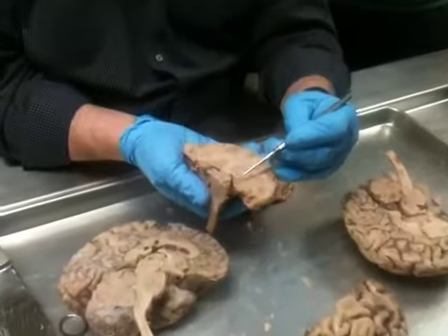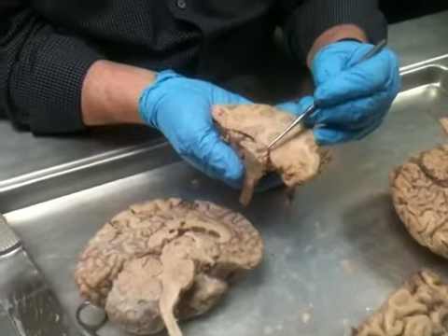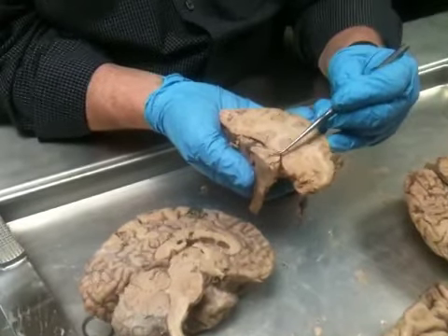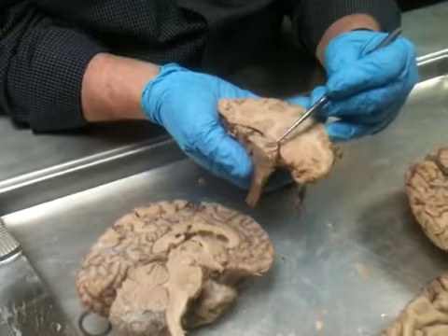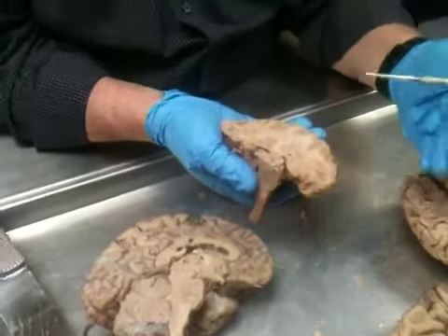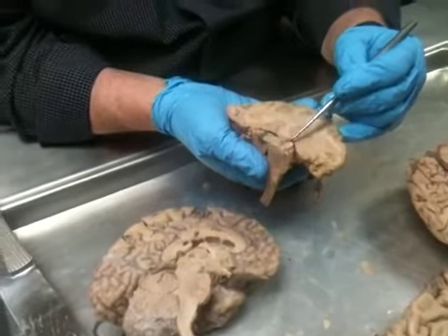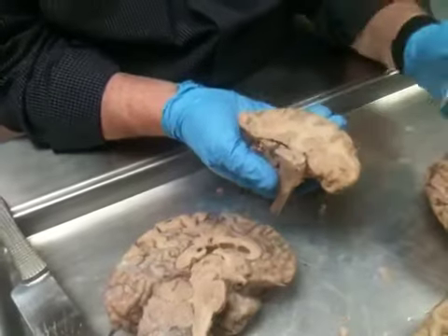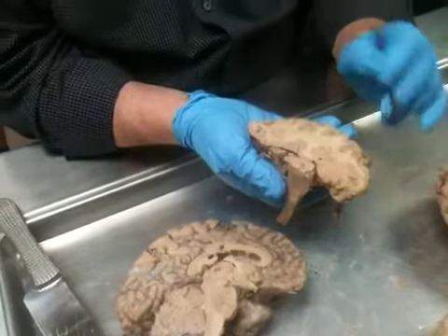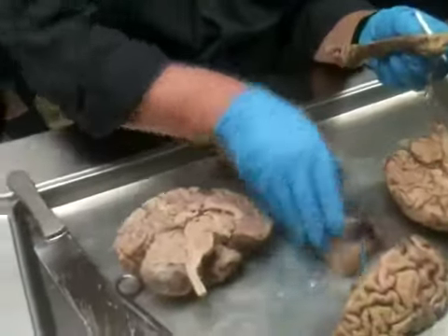you can see cerebral peduncles, and then you can see this black or darkened line right here. That's substantia nigra pars compacta. So you can actually see the melanin pigment that shows up in pars compacta for dopamine synthesis. You can actually see that in the brainstem. Okay? Now, I'm going to get rid of him for a minute.